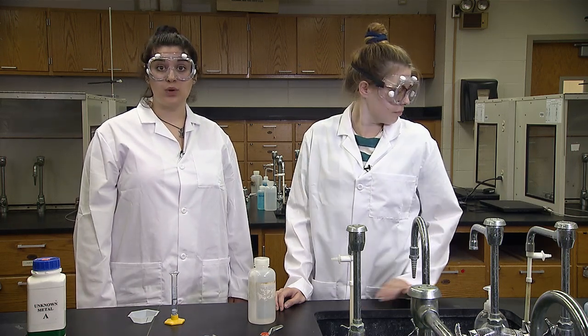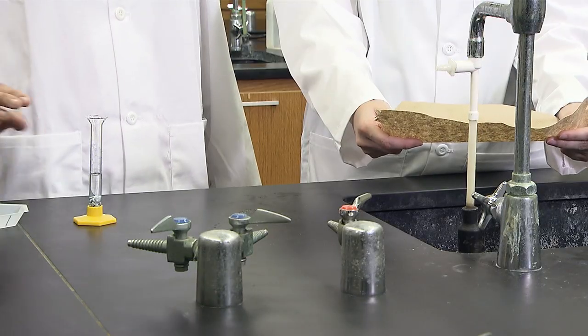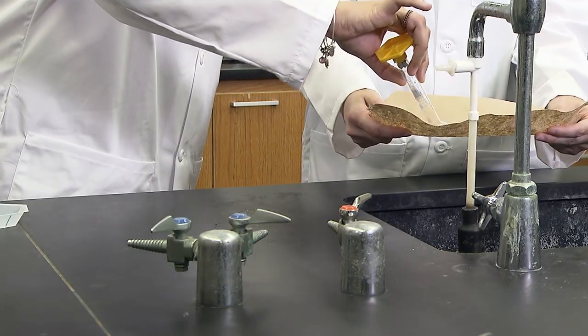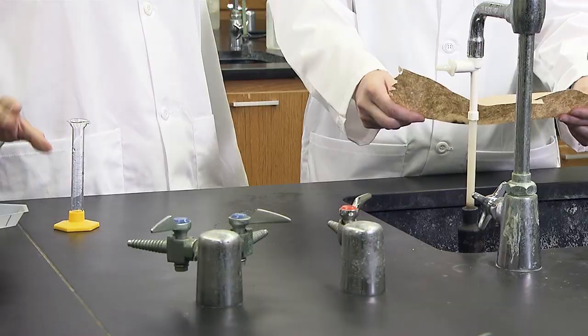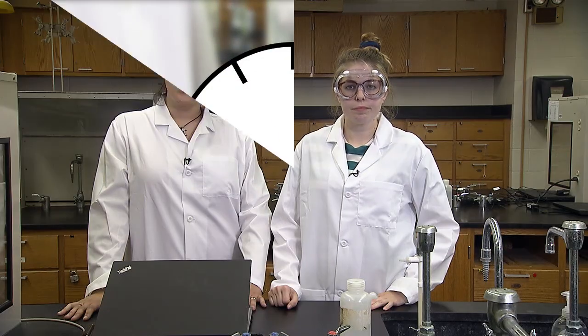Use a paper towel to catch the sample as you empty the cylinder in the sink. Be sure to get all of the metal from sample 1. Don't let any go down the drain. All the samples are in the paper towel and ready for the next volume measurement. When you have taken all your measurements, return the samples to the labeled waste containers on the cart.